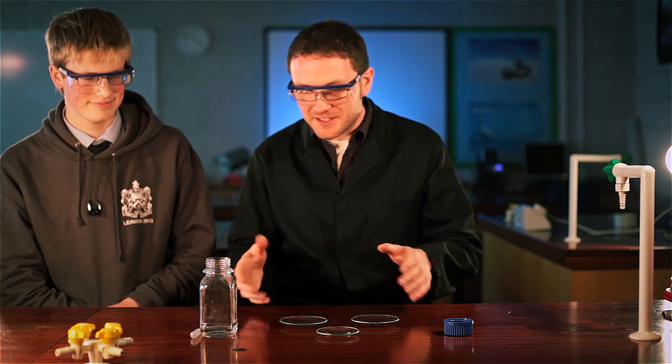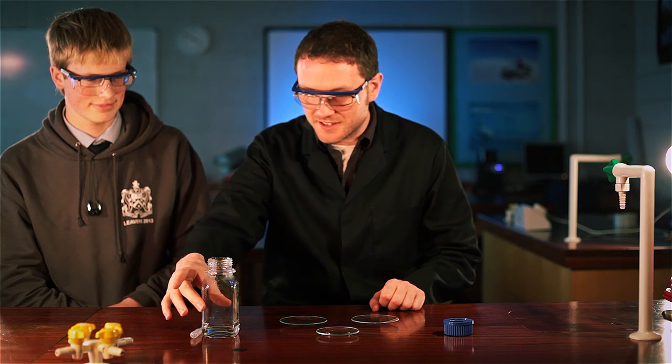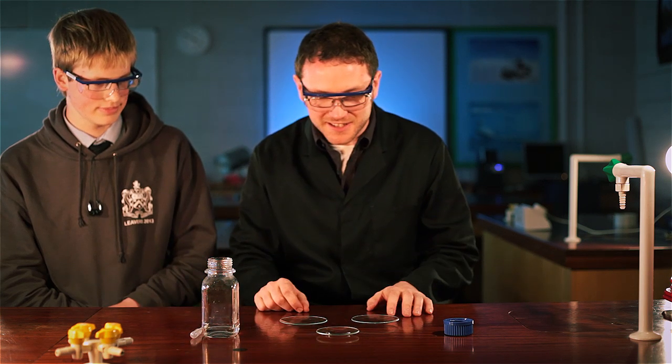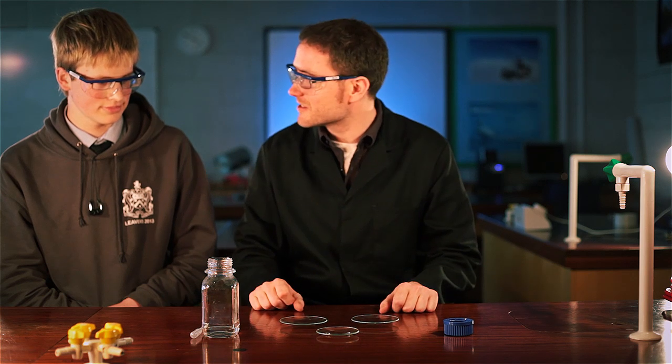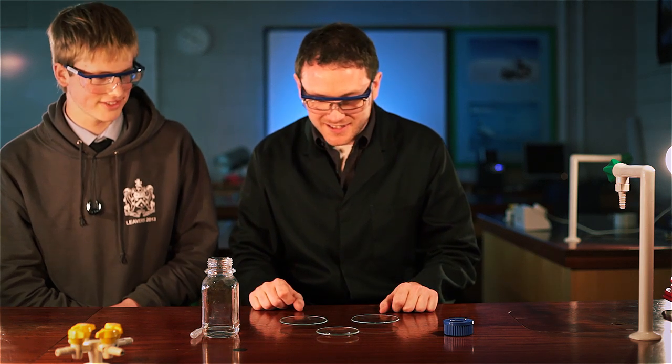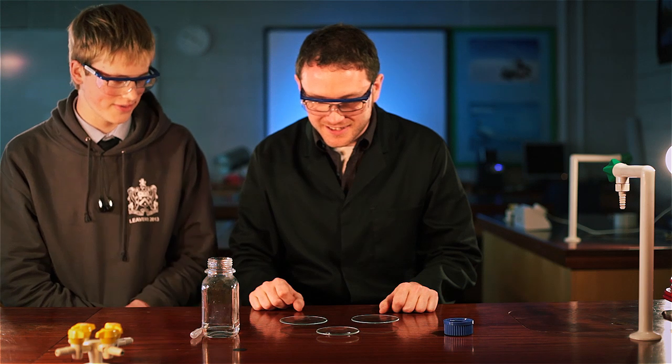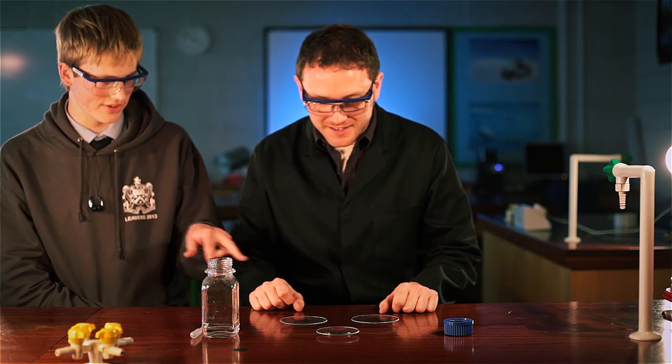And all I'm going to get you to do is drip some of this solution onto these petri dishes. Now, if you could just point out to the viewers what we've got on these petri dishes that you can see. Oh, there's some sort of solution on that one at the front there, and these two are both empty.